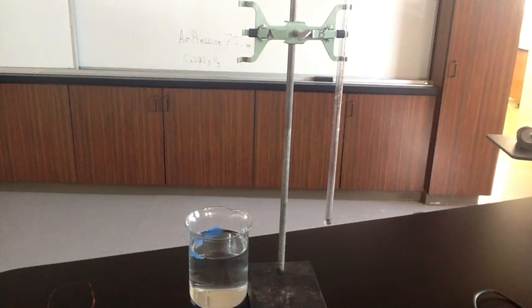Okay, this is the ideal gas equation lab where we're going to find the pressure, volume, number of moles, and temperature of a gas, and then use that to solve for the gas constant. Once we have the gas constant, we can use it in other applications using the equation PV = nRT. So we need to measure the other four gas variables: pressure, volume, number of moles, and temperature.